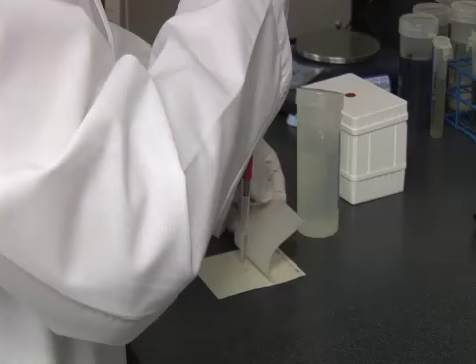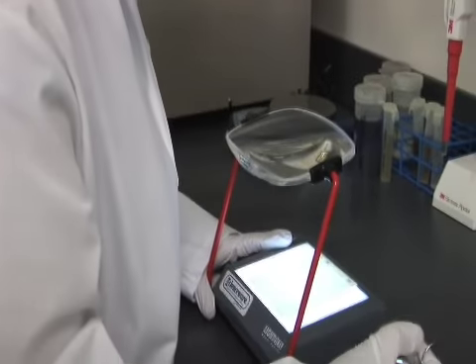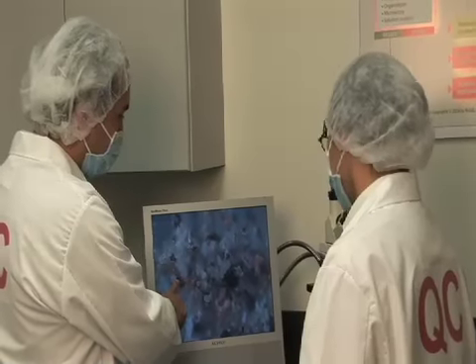The laboratory director analyzes the sample to see if it's free from harmful bacteria. If the powder fails this test, it goes for sterilization and then gets retested. The laboratory director also examines the powder to make sure that it is not contaminated with dirt or other particles.